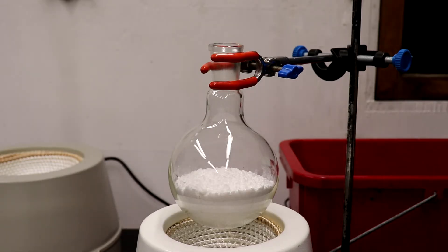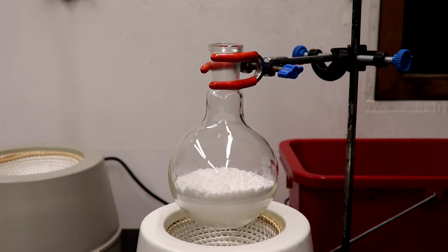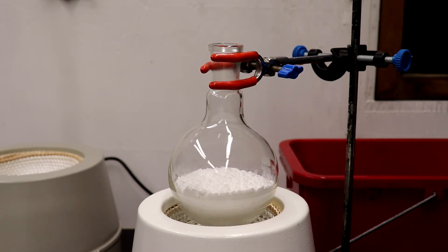I've added all of the P-Amino Benzoic Acid to the flask, so now I'm going to raise the heating mantle and set up for a simple distillation.